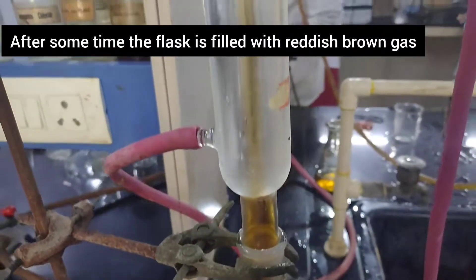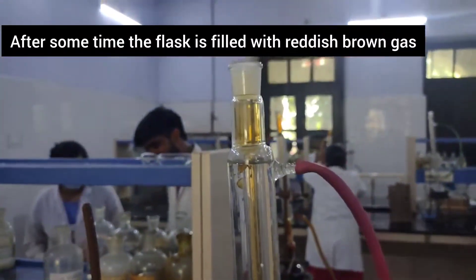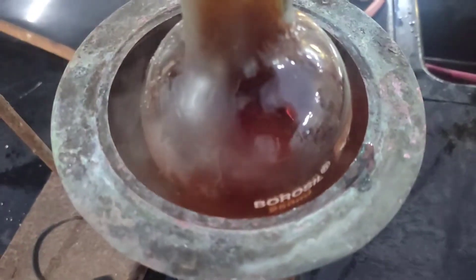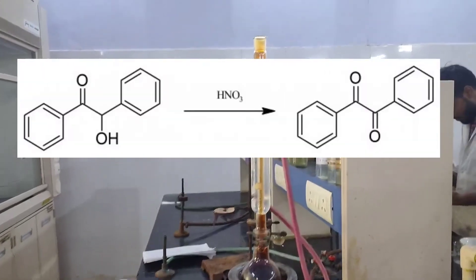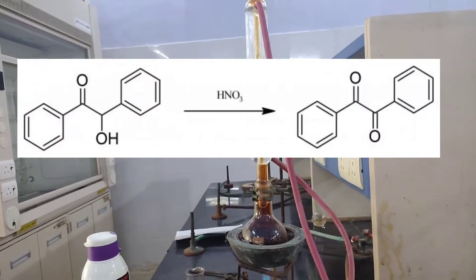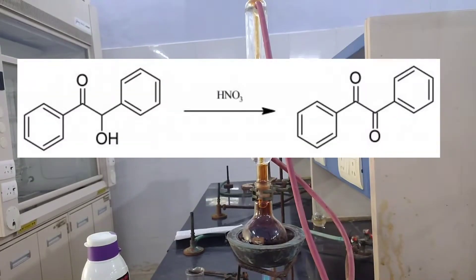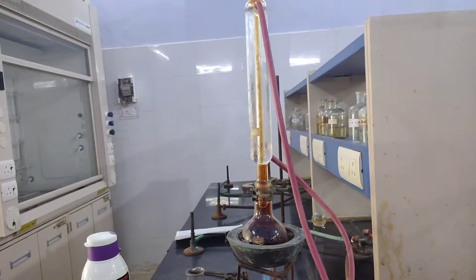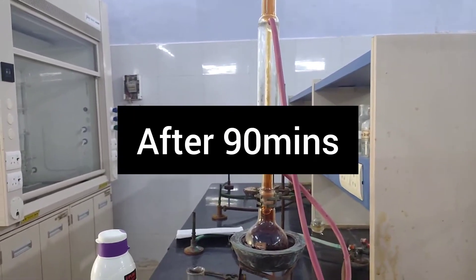After some time you will see that the flask and the condenser are filled with reddish-brown nitrogen dioxide gas. What is happening here is that benzoin is getting oxidized to benzil by the oxidizing action of nitric acid. Since we haven't used any sulfuric acid, no nitration takes place.